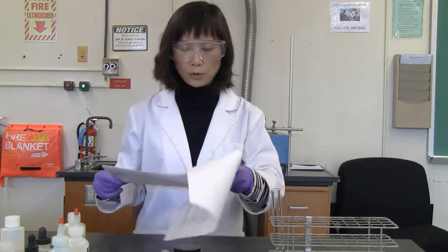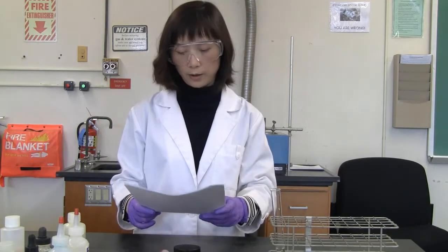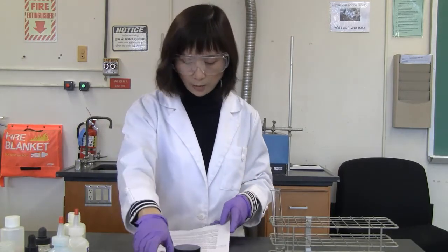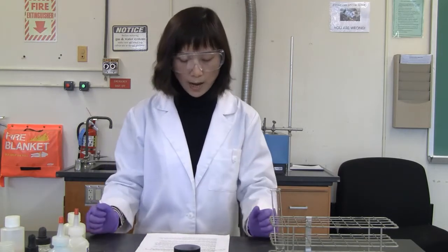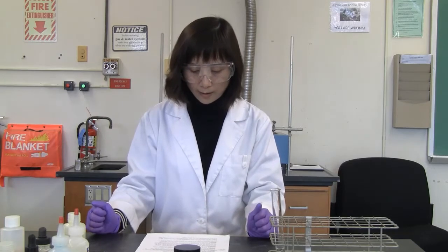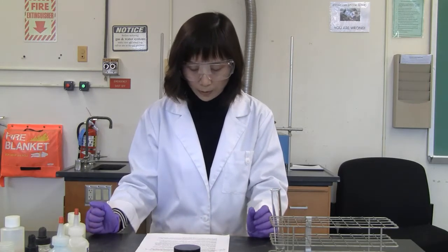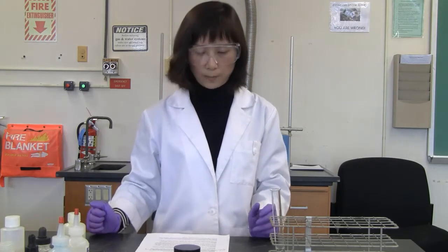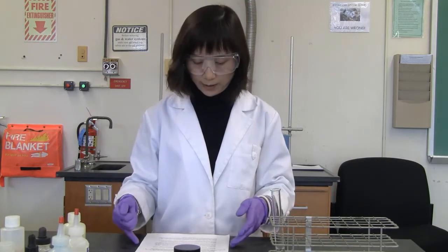Right now I'm going to run each reaction, so you're going to observe it clearly and closely, okay? And then write down the observation. So now, reaction 1. This one is already done, so I'm going to show you the result, like what the color or appearance of the reactants is, and what the color and appearance of the products is.